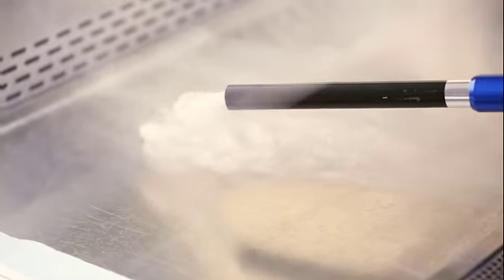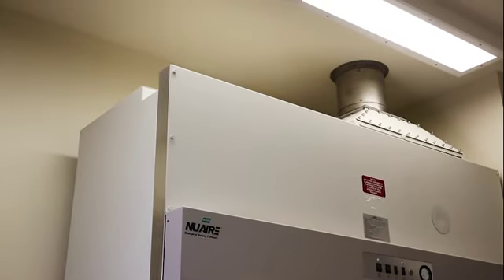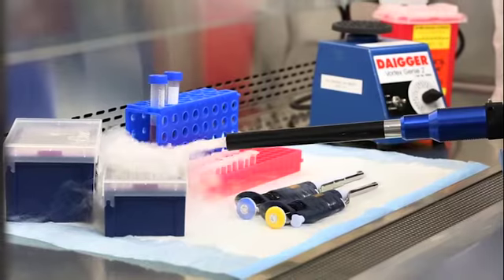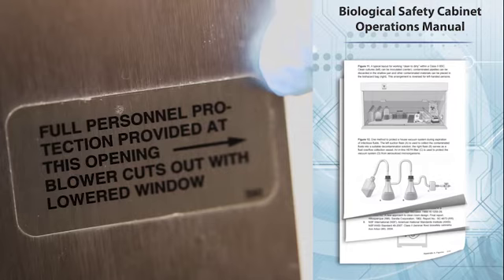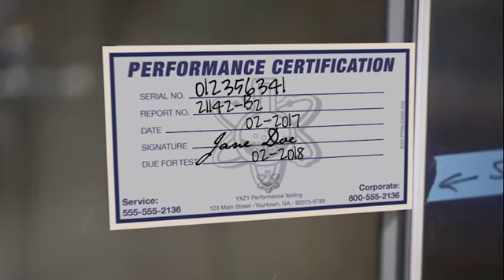The physical location of the BSC can affect the airflow as well. Placing a BSC too close to a doorway can cause the air to be drawn out of the BSC when a door is open. Placing a BSC too close to an HVAC supply vent can also interfere with the BSC containment. Proper sash height is critical because when the sash is kept at the proper height, the appropriate inward airflow can be maintained. The proper sash height is designated in the BSC operation manual and should be clearly indicated on the BSC. The performance of the BSC at the declared sash height is actually part of the cabinet certification process.